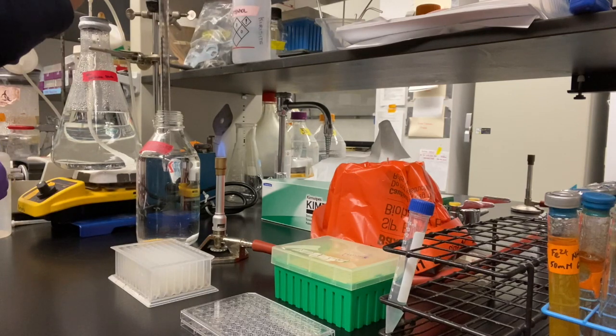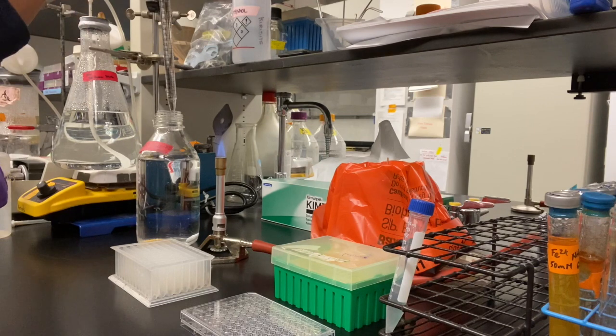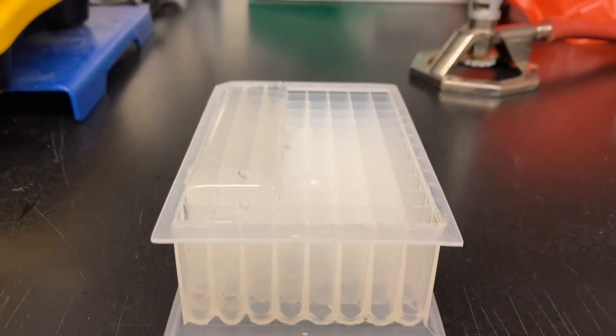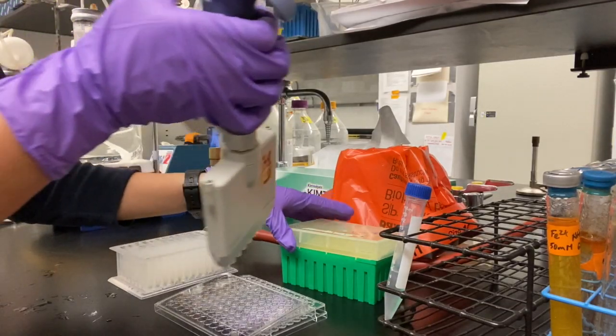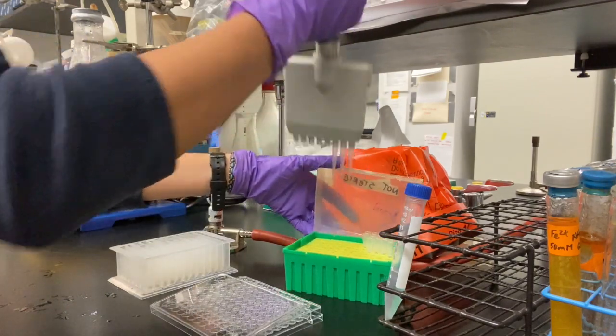I use the automatic pipette to quickly grab large volumes of the MD media to fill up the deep well. Once the deep well has the first 3 columns filled with MD media, we can now use 3 tips on the multi-channel pipette to pipette into the triplicates with ease. After the 200 microliter multi-channel pipette has been set to 180 microliters, grab 3 tips.